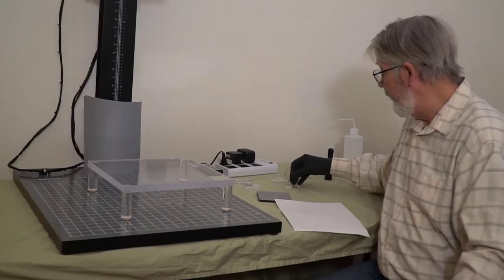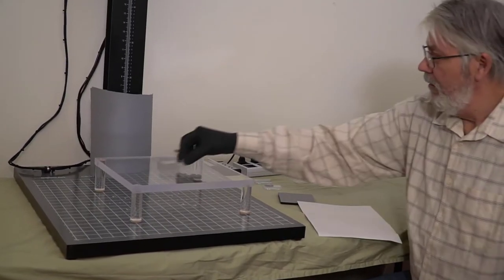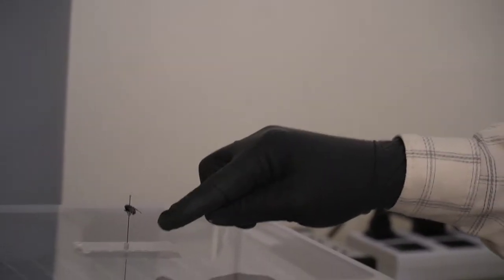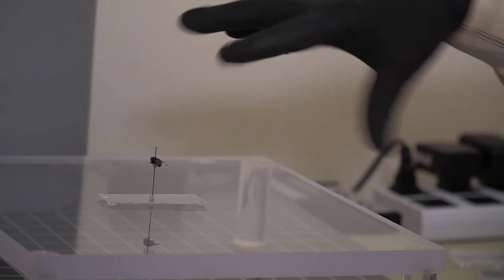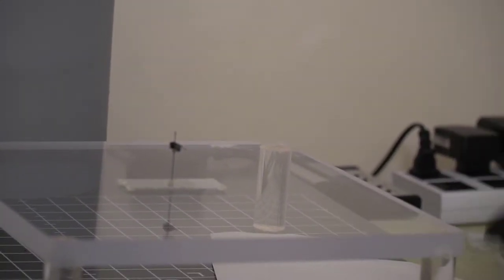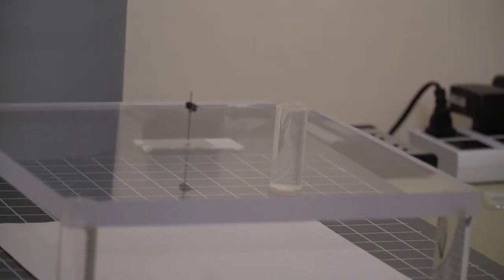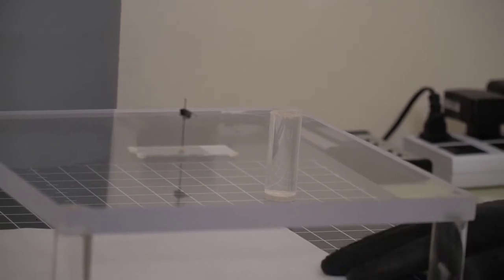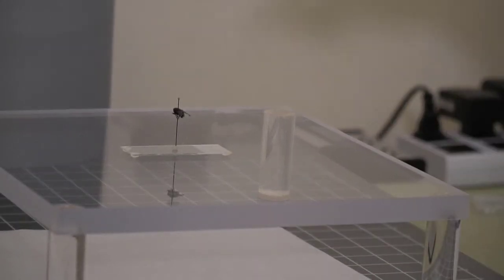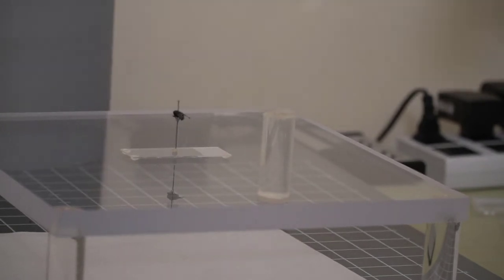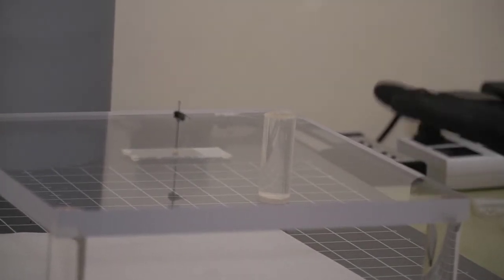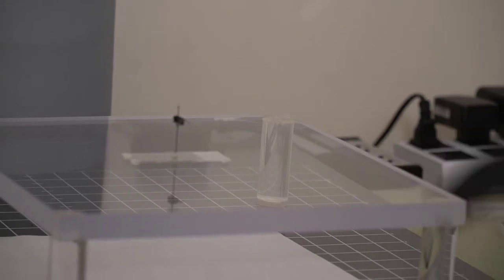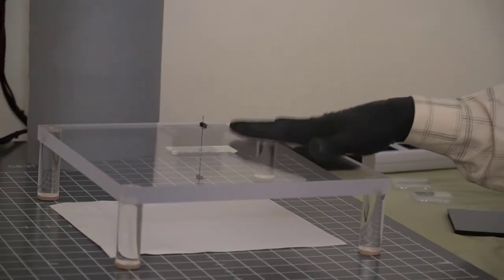If I have a specimen, I'll quickly show you with a fly sitting in a little dollop of wax on a pin. I can shoot straight down on it and there's no background to it. Now I can slide a white piece of paper, a gray piece, blue piece—doesn't matter—behind it. The paper is out of focus and any shadow from lighting is out of my field of view. So it's super important having this raised up off the base as our foundation.